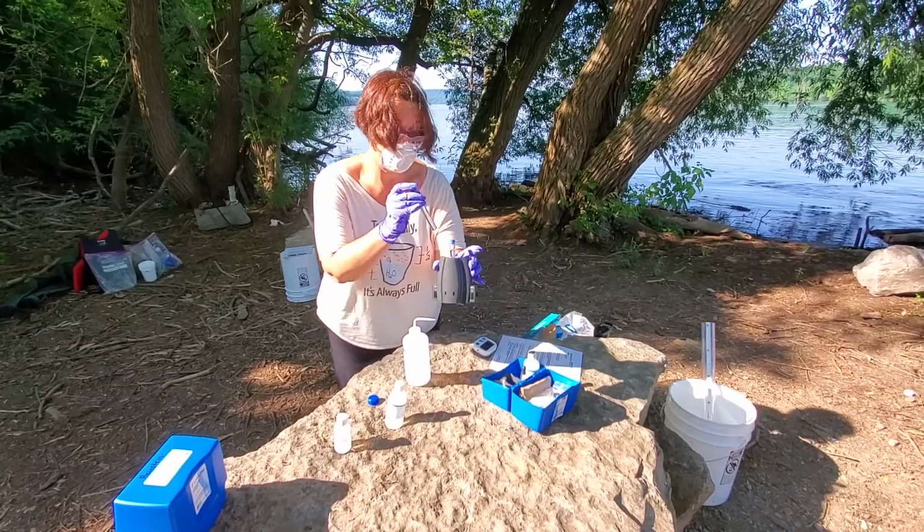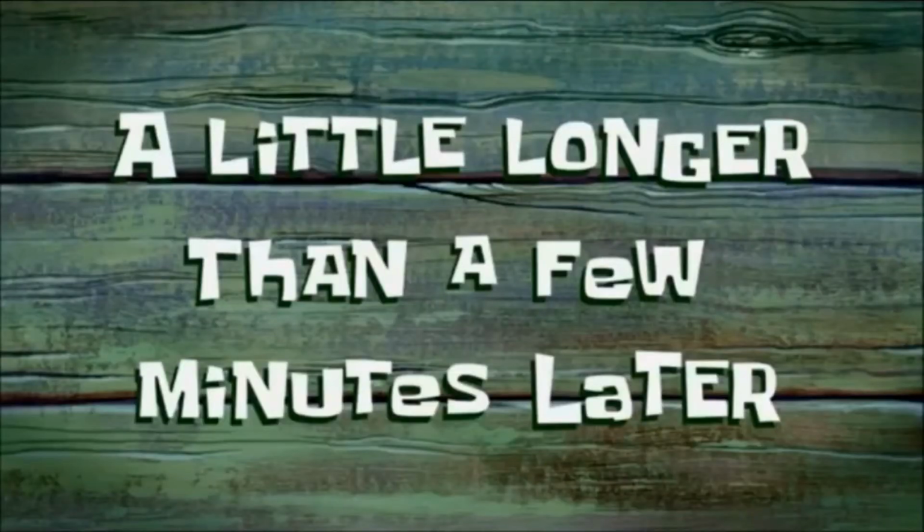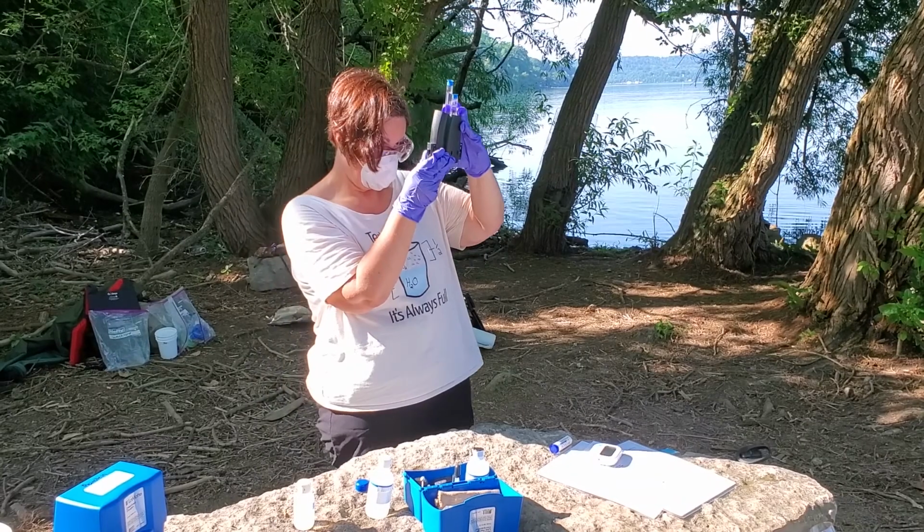And now we wait 10 minutes. A little longer than a few minutes later.